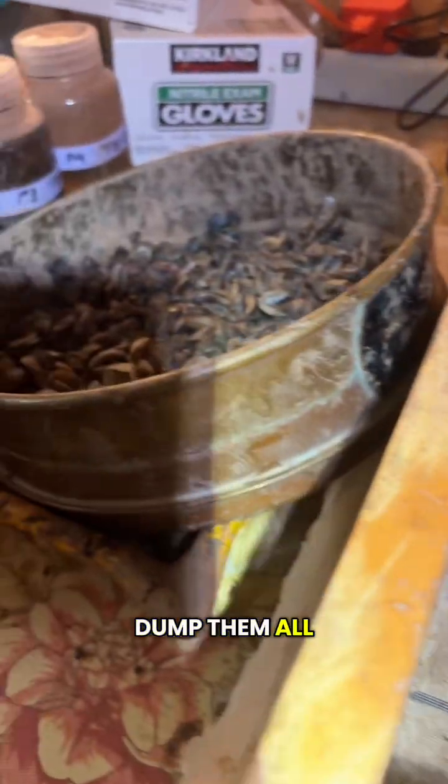So I'm going to dump them all from the sieve into this tray here, and there's 30 squares in this tray. And the reason for that is we want to randomly select the zebra mussels that we are measuring because that eliminates bias. So like if I wasn't using this tray, I would instinctively pick the biggest ones because I want to know how big they are, right?